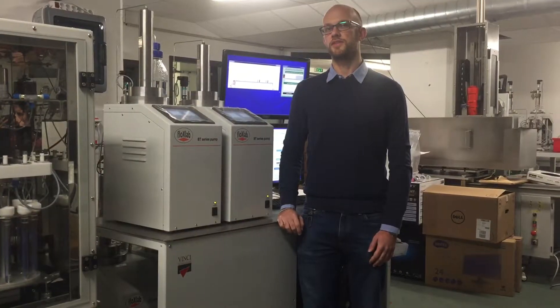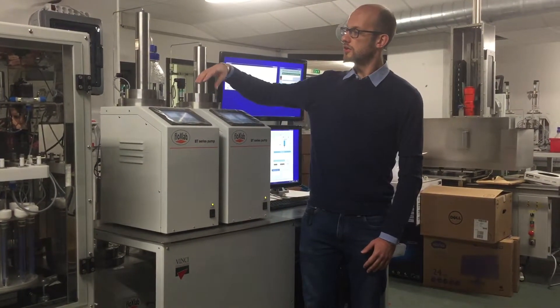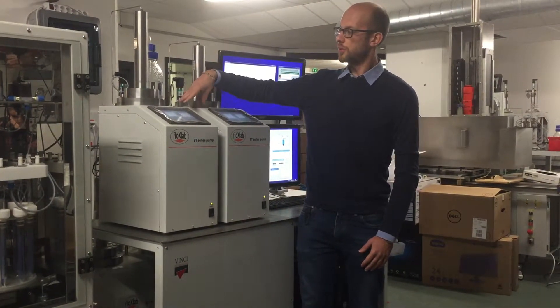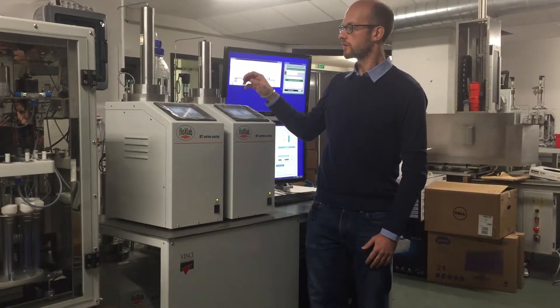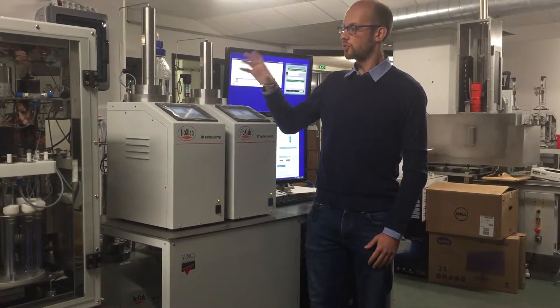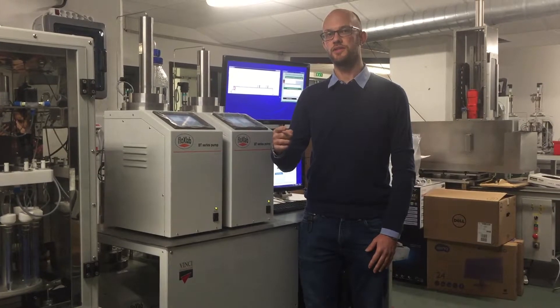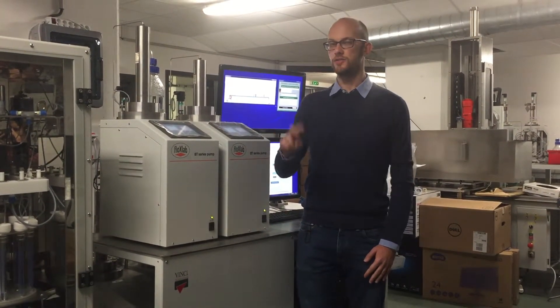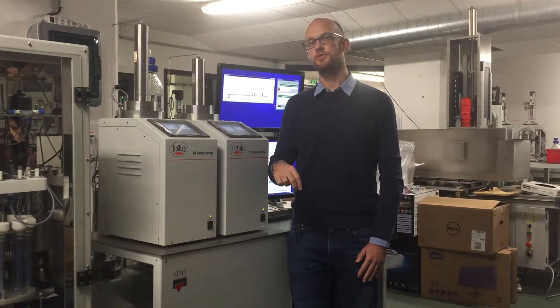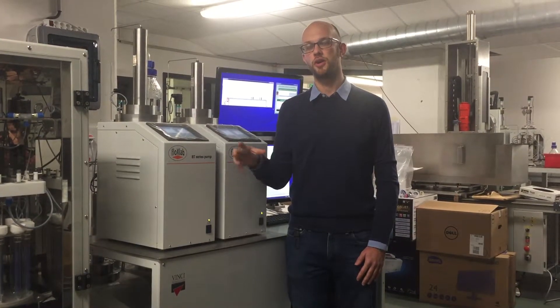The steam flood has four pumps — two double pumps. Two pumps are at the top and two pumps are at the bottom. One double pump is used to inject continuously inside the system. The other two pumps are used in order to confine the core holder and also apply back pressure on the system.